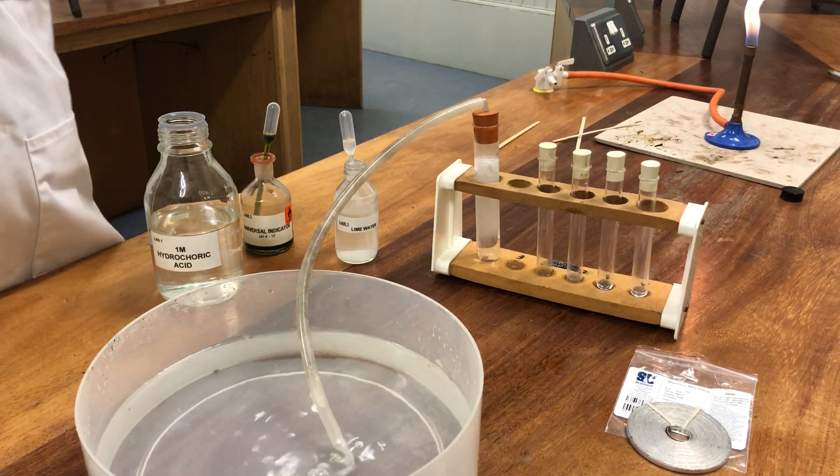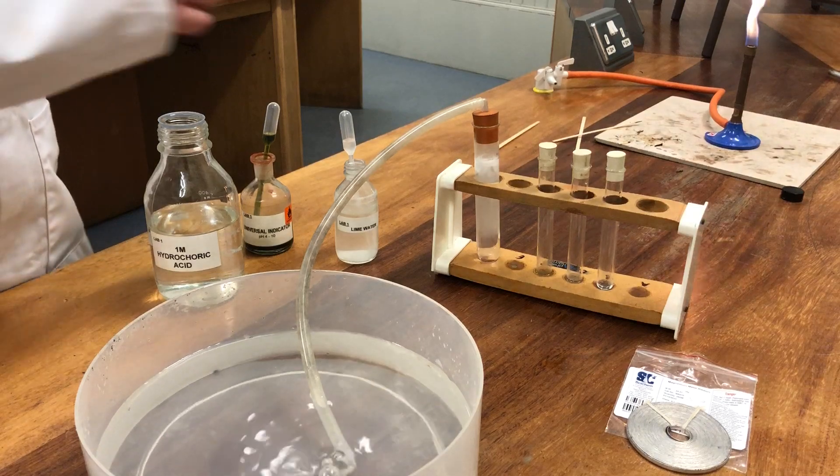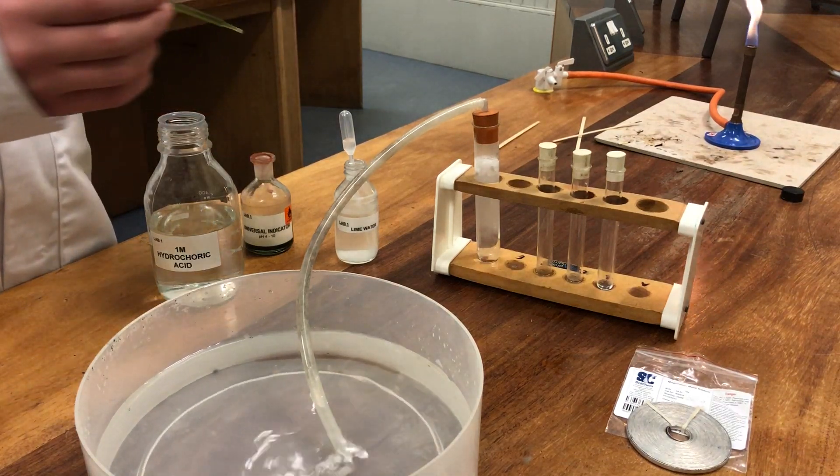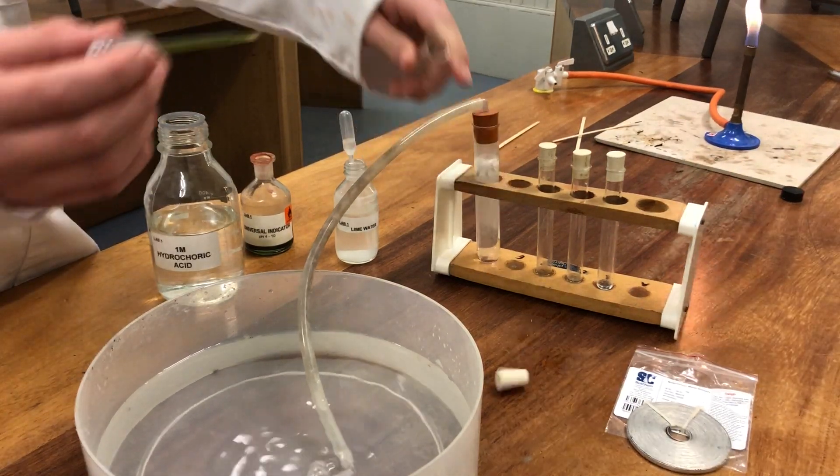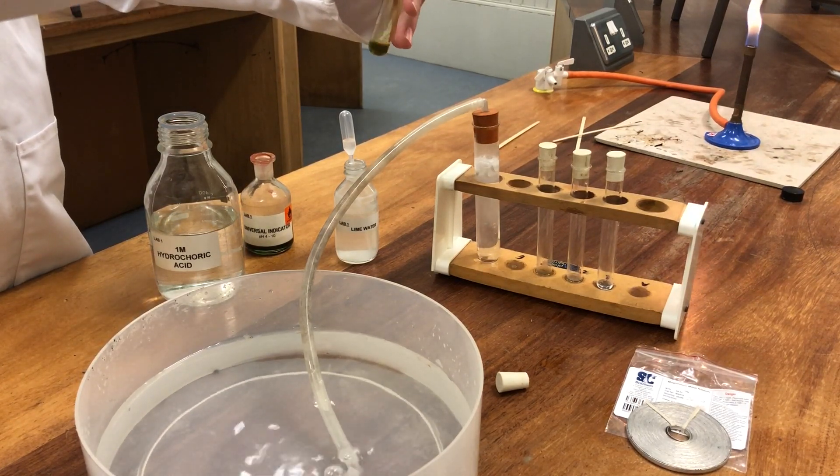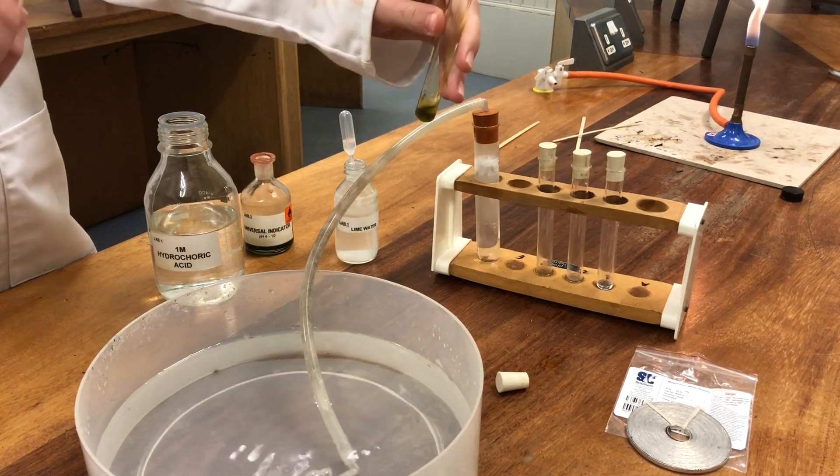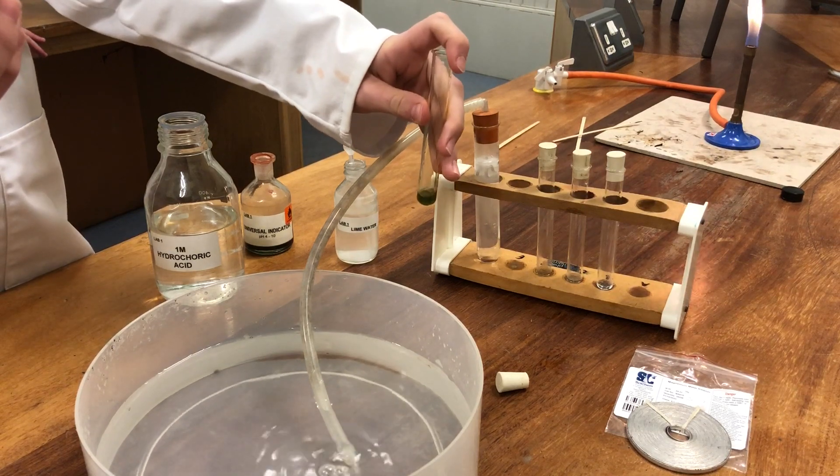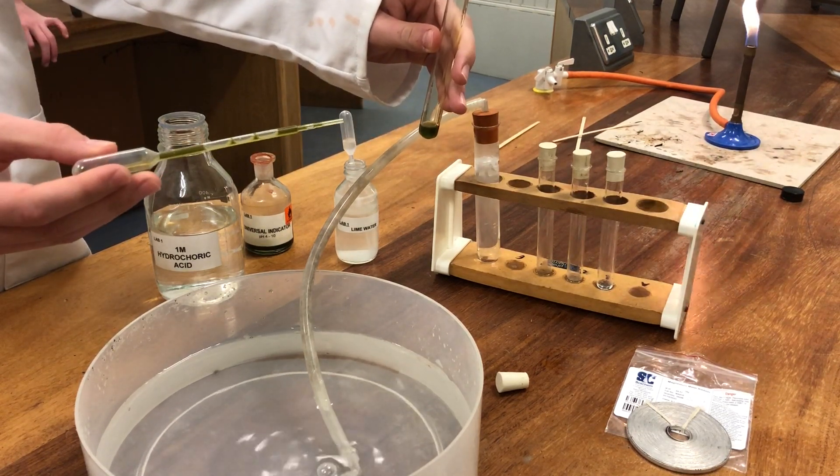The first gas test will be the universal indicator solution. You will see no change there at all, it just remains green.